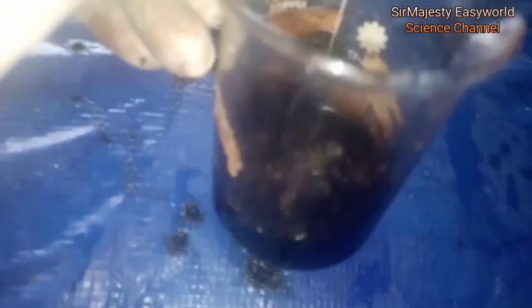It's very hot. Concentrated H₂SO₄ as before — dehydrating the watermelon juice, turning it from red to black, converting it to charcoal. Concentrated H₂SO₄ is a powerful dehydrating agent, and it burns and attacks organic matter by dehydrating them, removing water from them, and that makes H₂SO₄ dangerous, especially when it's concentrated. See what it has done to this watermelon? That's what it will do to your skin or any part of your body when it comes in contact with it. It burns it down like an open flame. Wow, the watermelon completely burned down — it's now black charcoal.